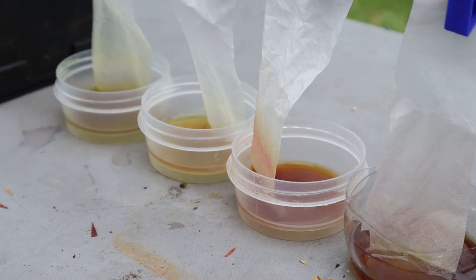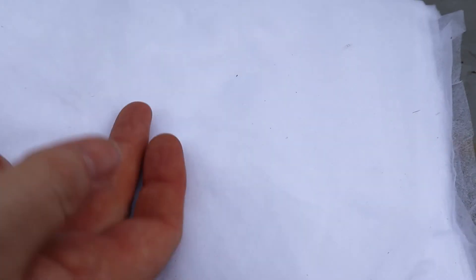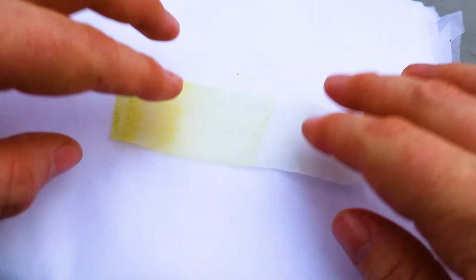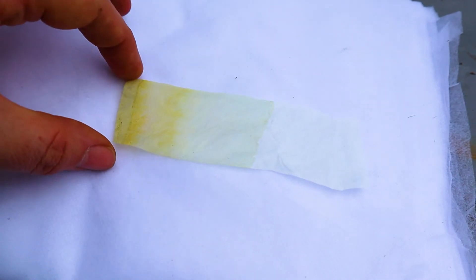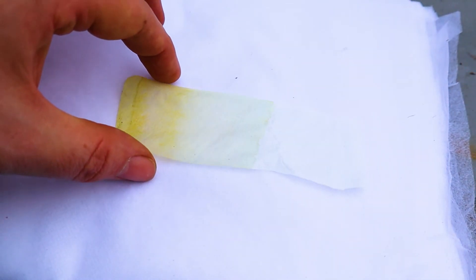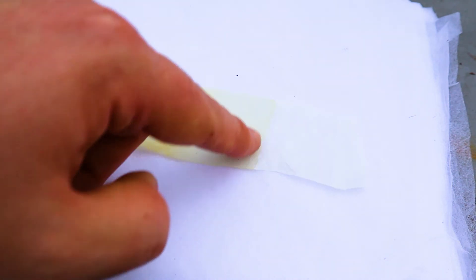The papers have all dried out now. I've got some white horticultural fleece to use as a white background so we can see the colours a bit better. Starting with the green leaf — which was a bit of a greeny yellow — all the green is separated out at this end. We've got a nice dark yellow here, and then it goes into a lighter yellow up at the top. So we can see both the green and the yellow pigment in there.